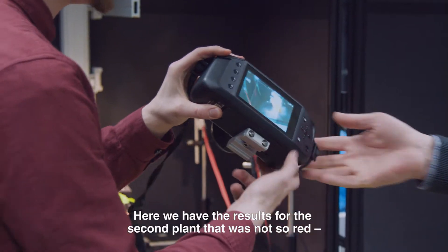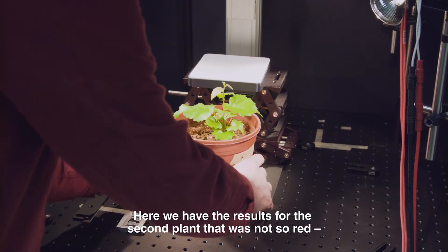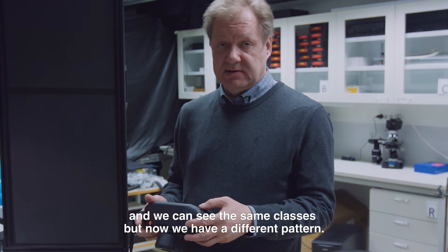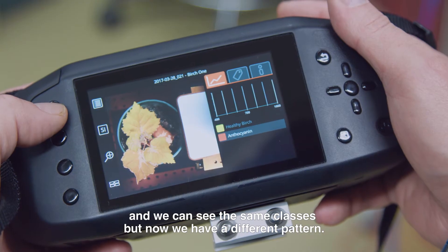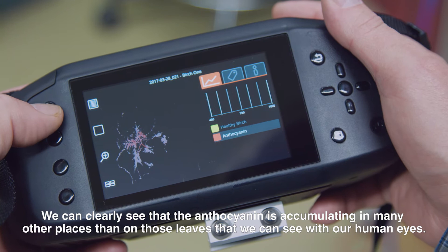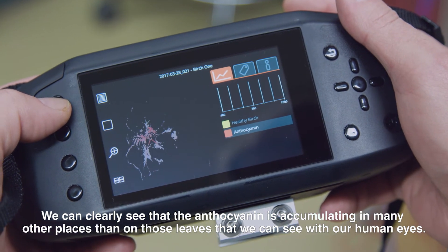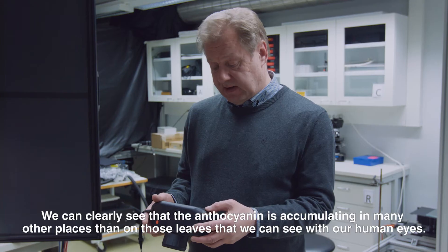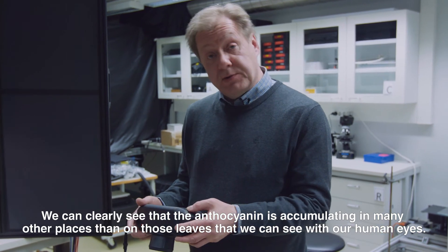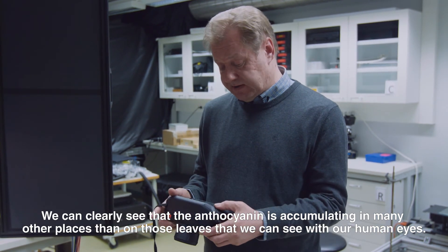Here we have the results for the second plant that was not so red, and we can see the same classes but now we have a different pattern. We can clearly see that the anthocyanin is accumulating in many other places than on those leaves that we see with our human eyes.